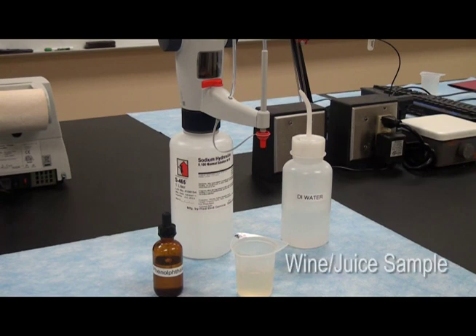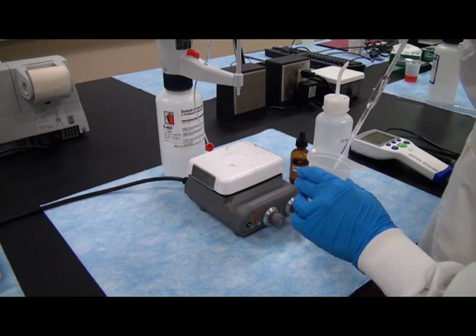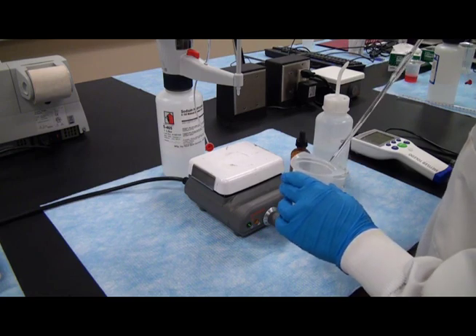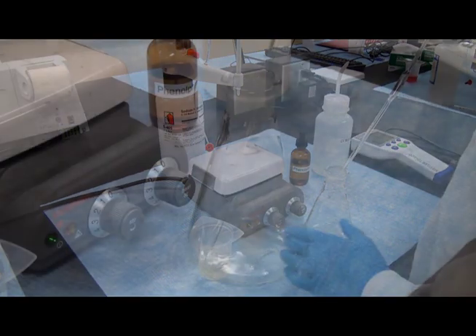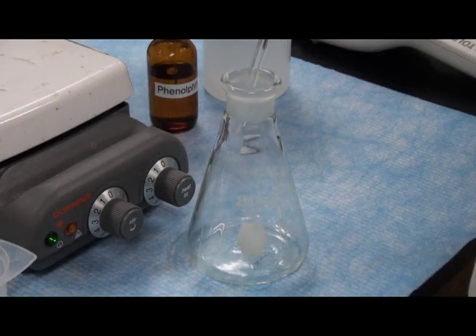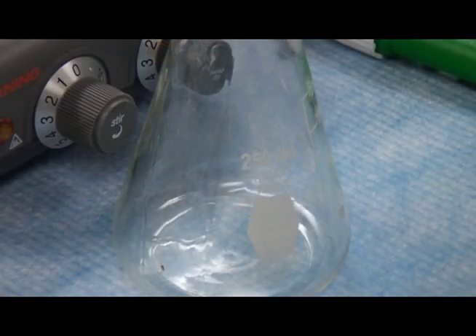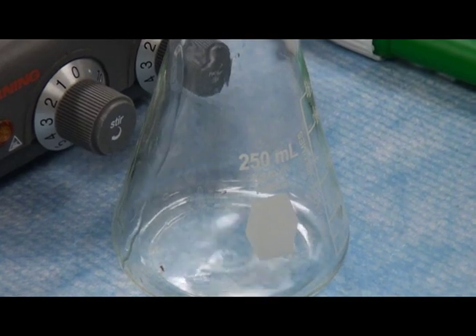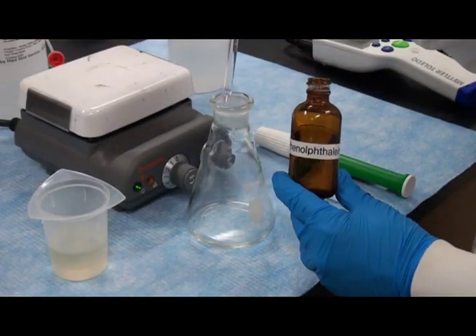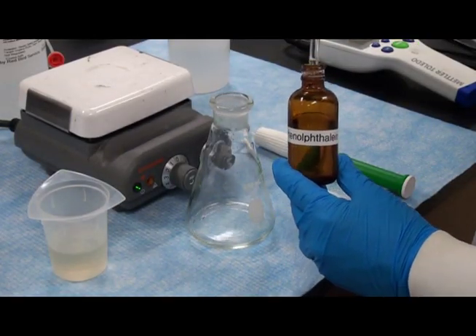Pipette 5 ml of wine or juice must into an Erlenmeyer flask. Add approximately 2 ml of DI water to cover the bottom of the flask with liquid, and then add 3 drops of 1% phenolphthalein.